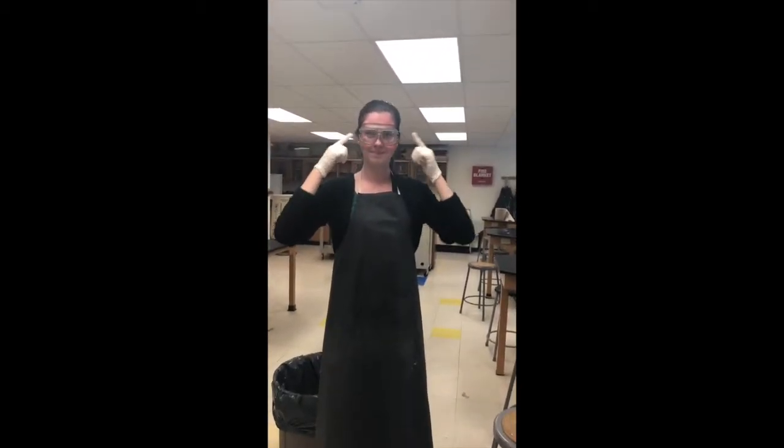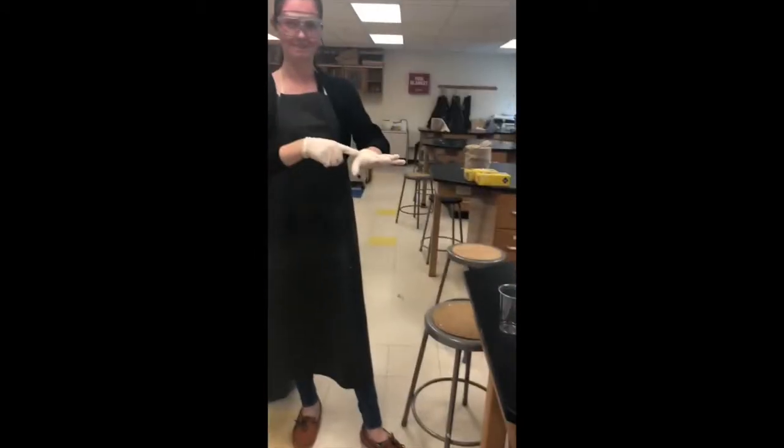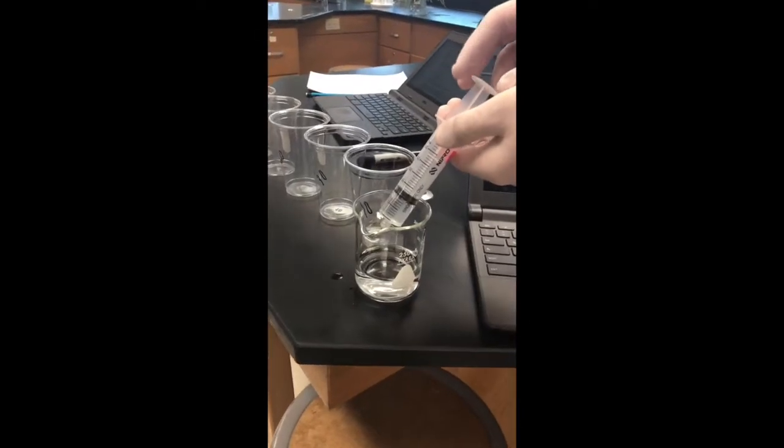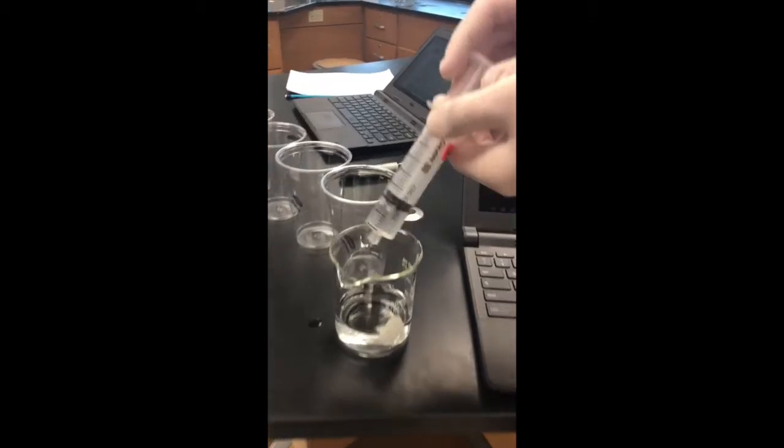Before beginning this experiment, it is important that all members of the group are dressed safely and appropriately for the lab due to the harmful chemicals that will be handled during this procedure. In this lab, wearing an apron, goggles, gloves, closed-toed shoes, and long hair tied back was necessary in order to protect the group members from the dangers that this lab presents.